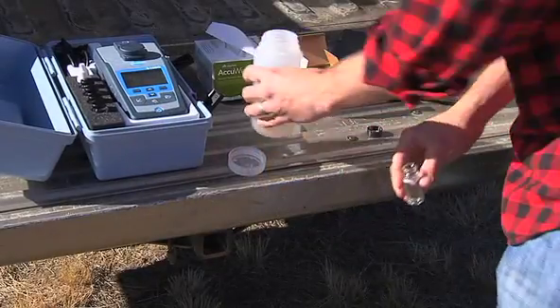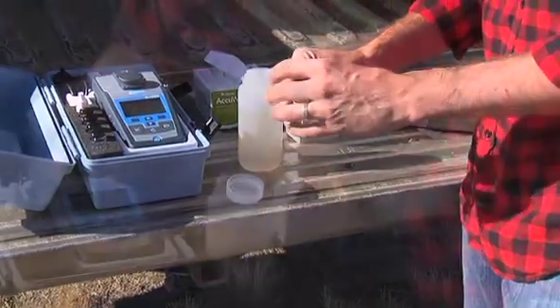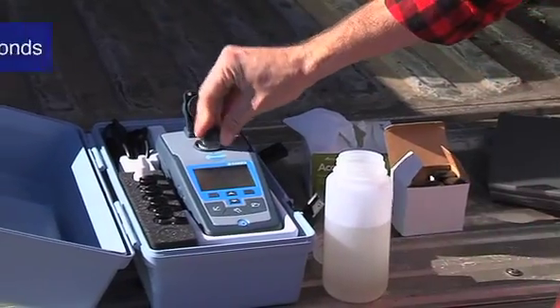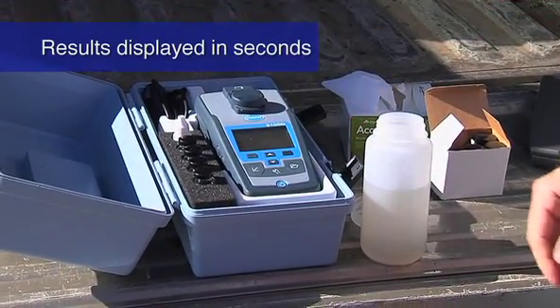First, the water sample is collected and poured into the provided sample cell. The sample cell is inserted into the cell compartment, and the result is displayed in seconds.